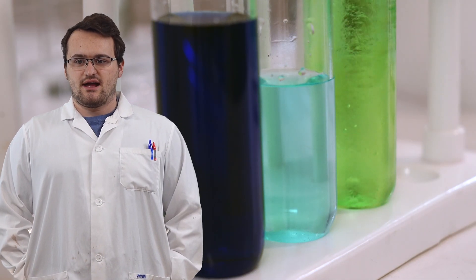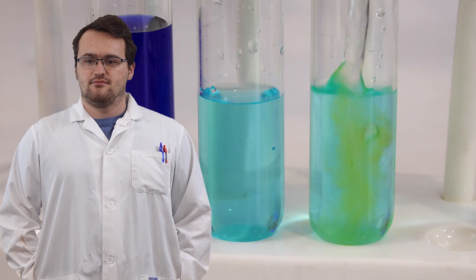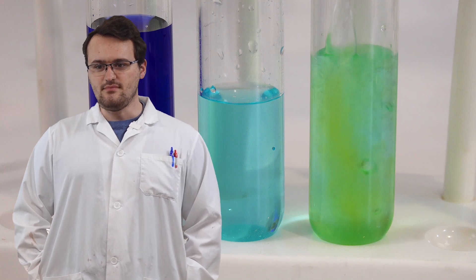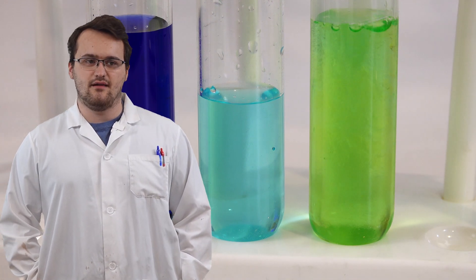On the right, we're going to add hydrochloric acid to our copper chloride. And you get this green color.